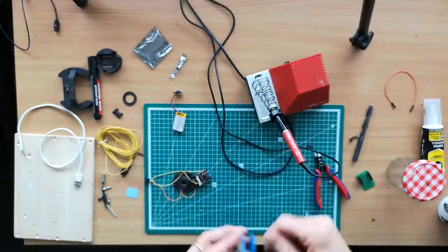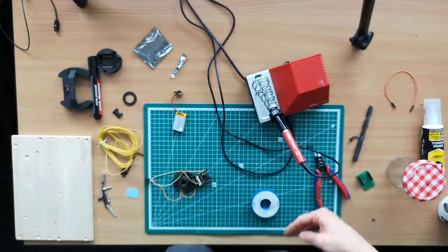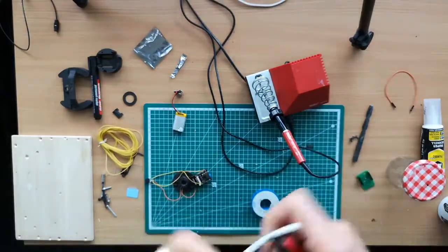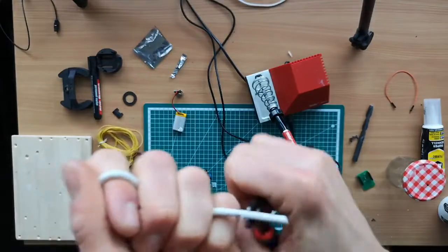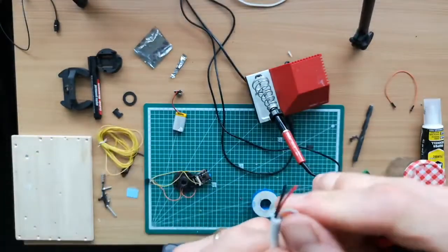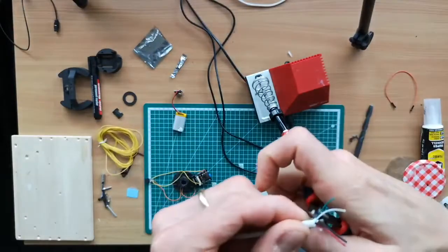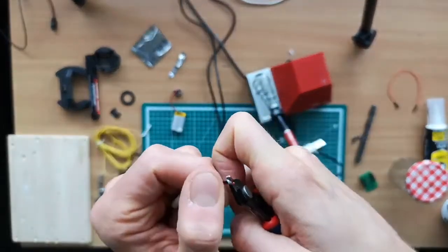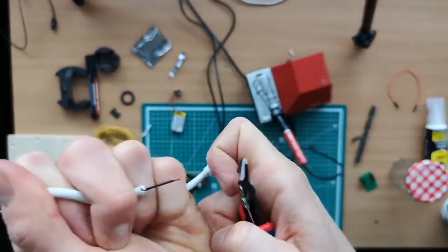And then you have to wire whatever USB cable you find to the ESP so that it can connect to the freshly created power bank. So for this, we again remove the isolation. The tricky part here with this one. And then what you have typically are at least the red and the black wires, so you can just cut away the rest. And then you have plus and minus connecting to 5 volts and ground again.